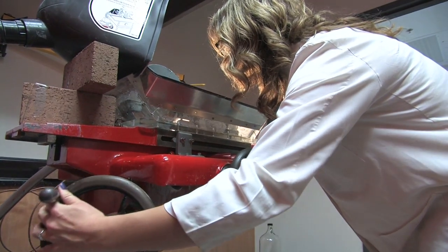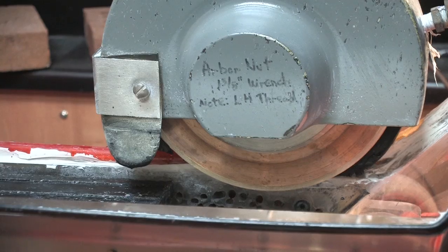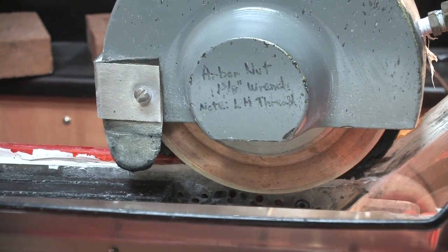You'll also want to check the blade so that it is just below the surface of the plate. You don't want to cut too deep when you're making your cuts.